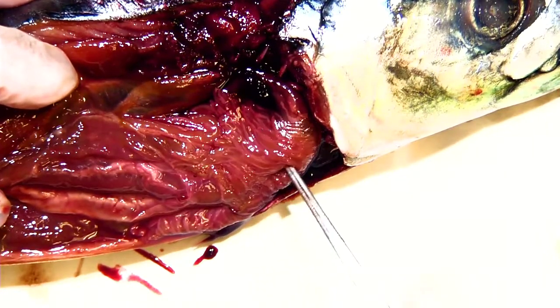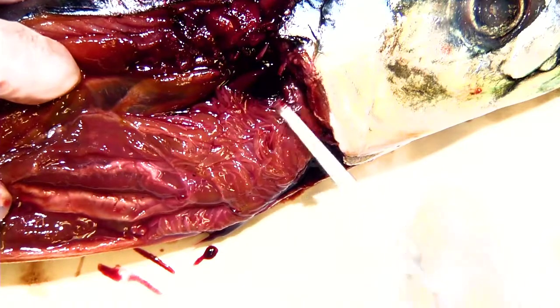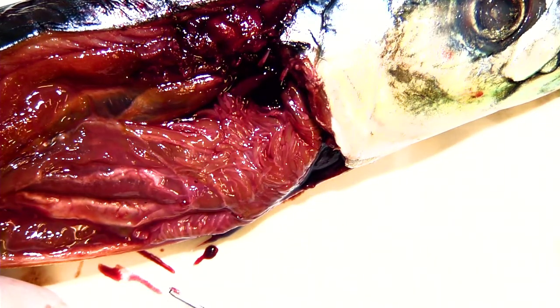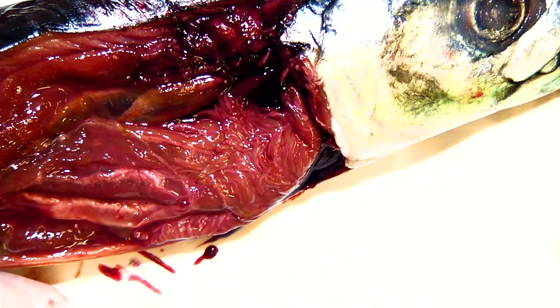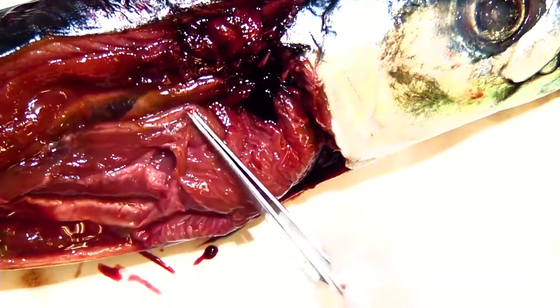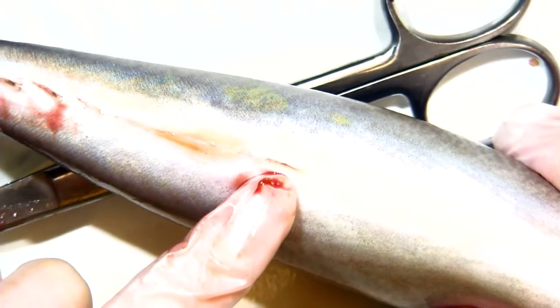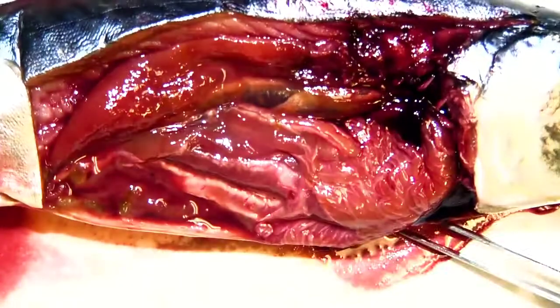Do you see all of this right here with lots of little lines? This is called a pyloric ceca, and basically it's used for digestion as well. There's so many lines because there's a ton of surface area so that nutrients can be absorbed from the food — for us, we have our small intestines all wound around like crazy, and as food passes through we get the nutrients. That's basically what this is here. After it's completely digested and gets all the nutrients it can, it goes to the bathroom through a small opening on the bottom called a cloaca. The cloaca is an all-purpose out hole — it's where they go to the bathroom and also where they lay eggs.